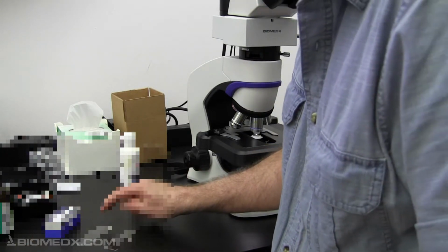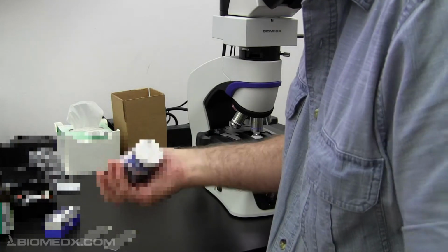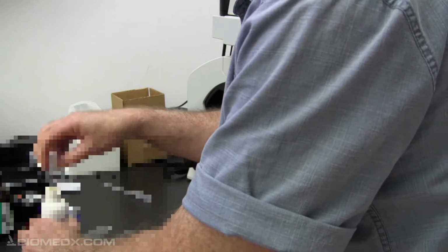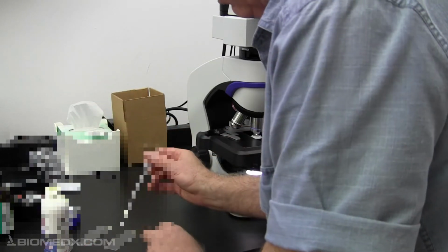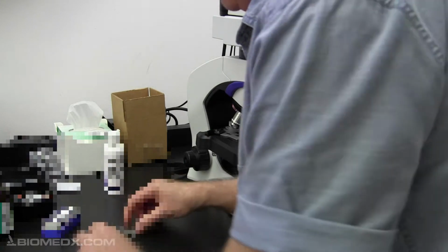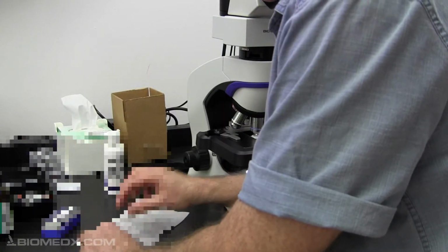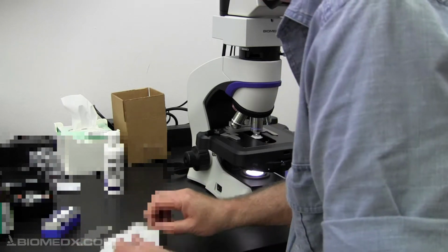So here's your slide. I have another product that was in the refrigerator. I did some work for them a while back. This expired in 2017. I'll shake that up. It's a very different consistency. This is almost like milky, where the product that I just did was more like clear, like water. So I'll put one drop there. I'll put the cover slip on it, and I will put the Kim wipe down and get that liquid off the edges. Okay, so here's your slide, this product.